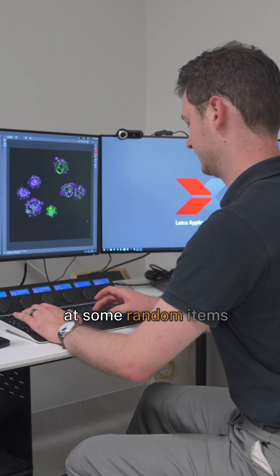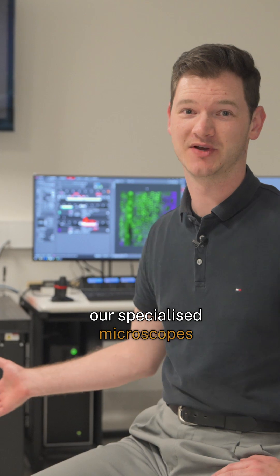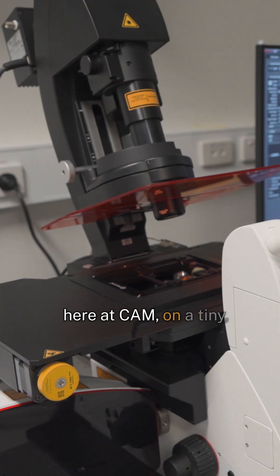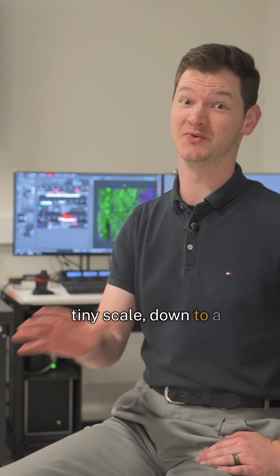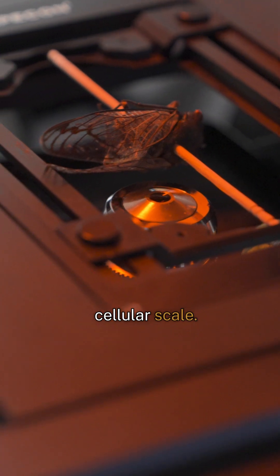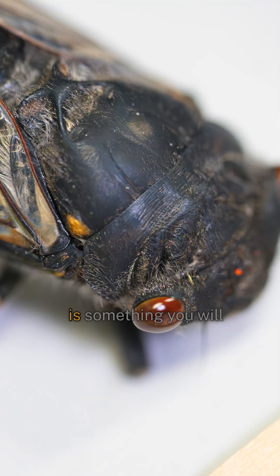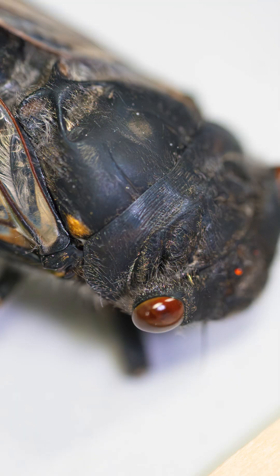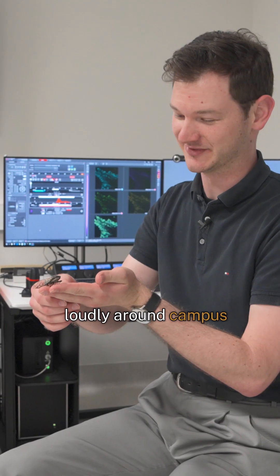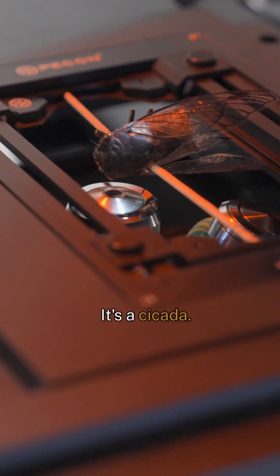Today we'll be looking at some random items from around the ANU on our specialized microscopes here at CAM, on a tiny tiny scale, down to a cellular scale. The first thing we're going to look at is something you will have heard buzzing very loudly around campus for the last few weeks — it's a cicada.